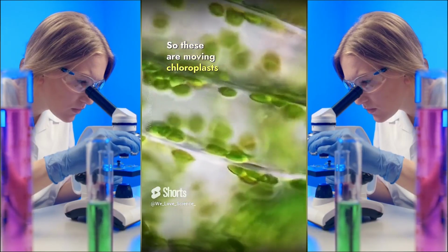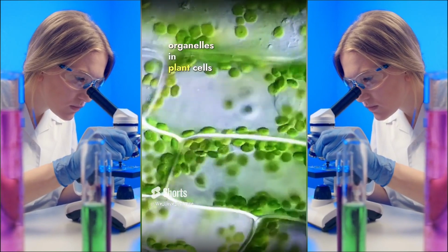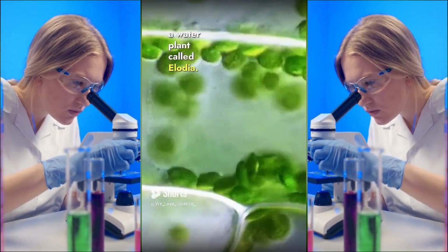So these are moving chloroplasts under the microscope. Chloroplasts are the cell organelles in plant cells that are responsible for photosynthesis. And this is a time-lapse video of a water plant called Elodea.